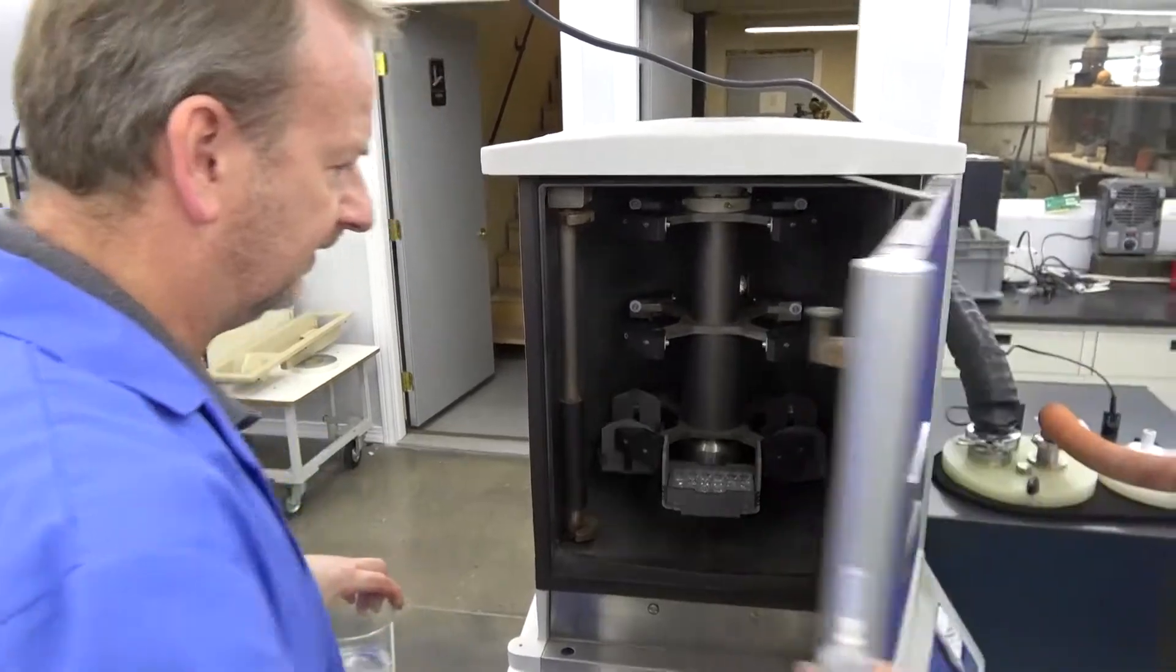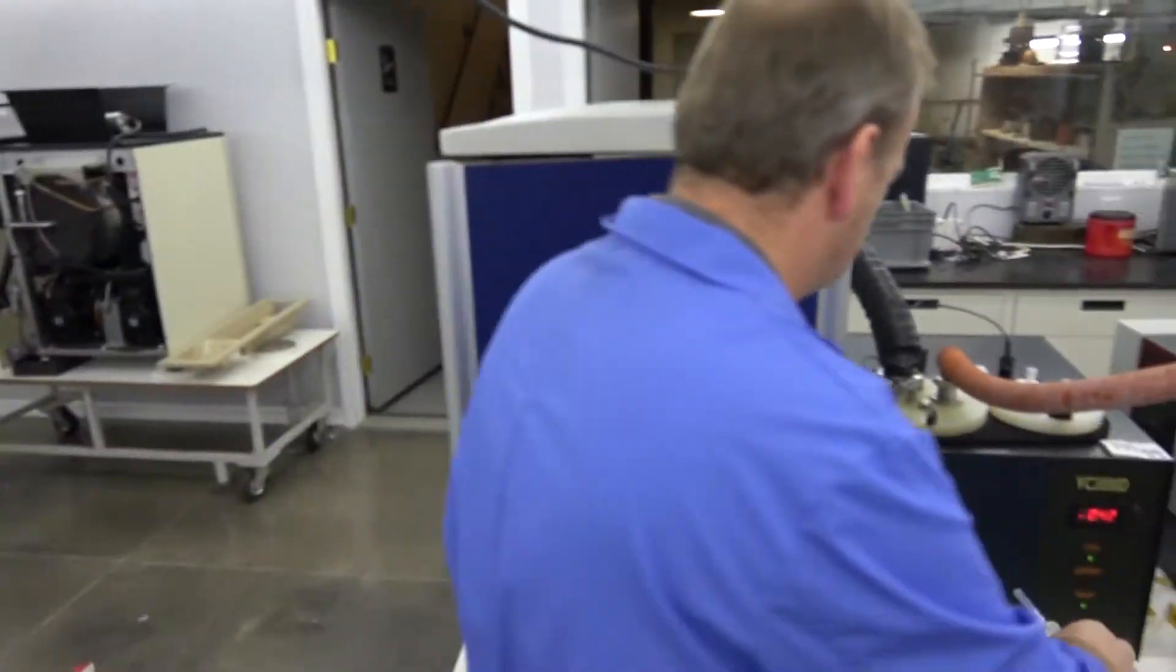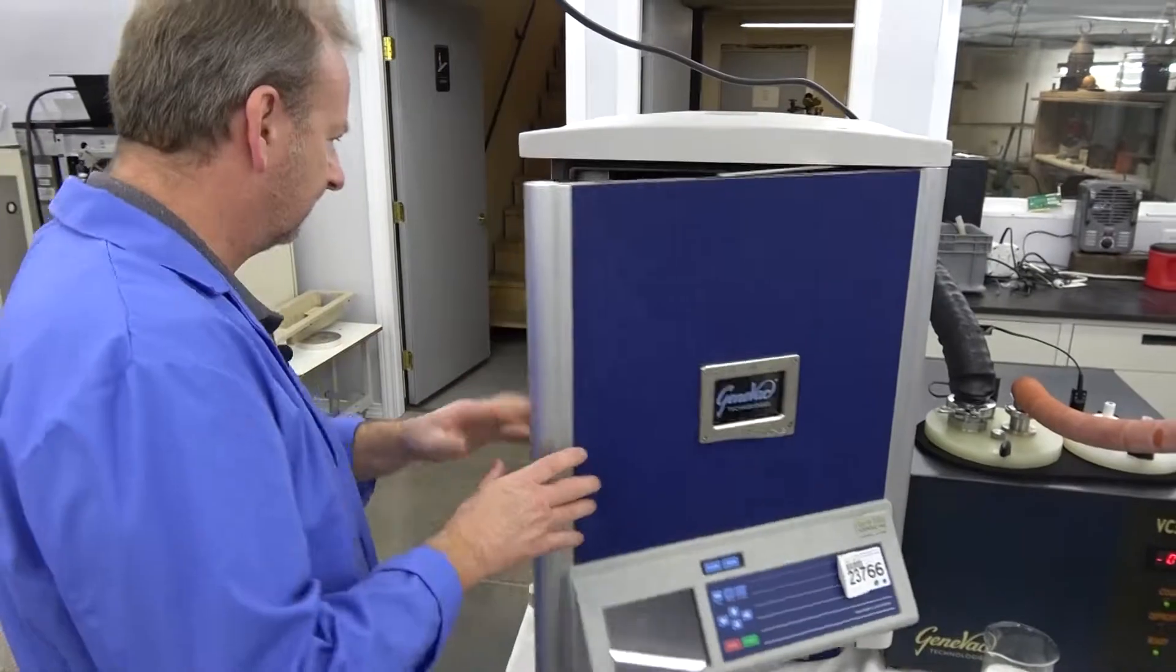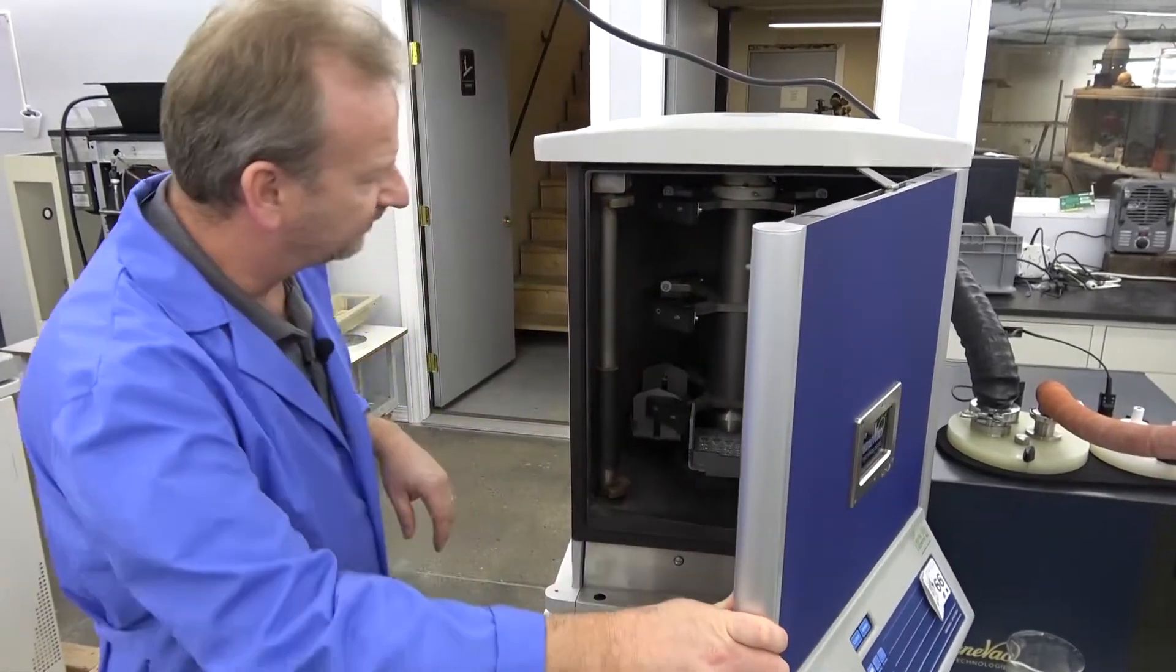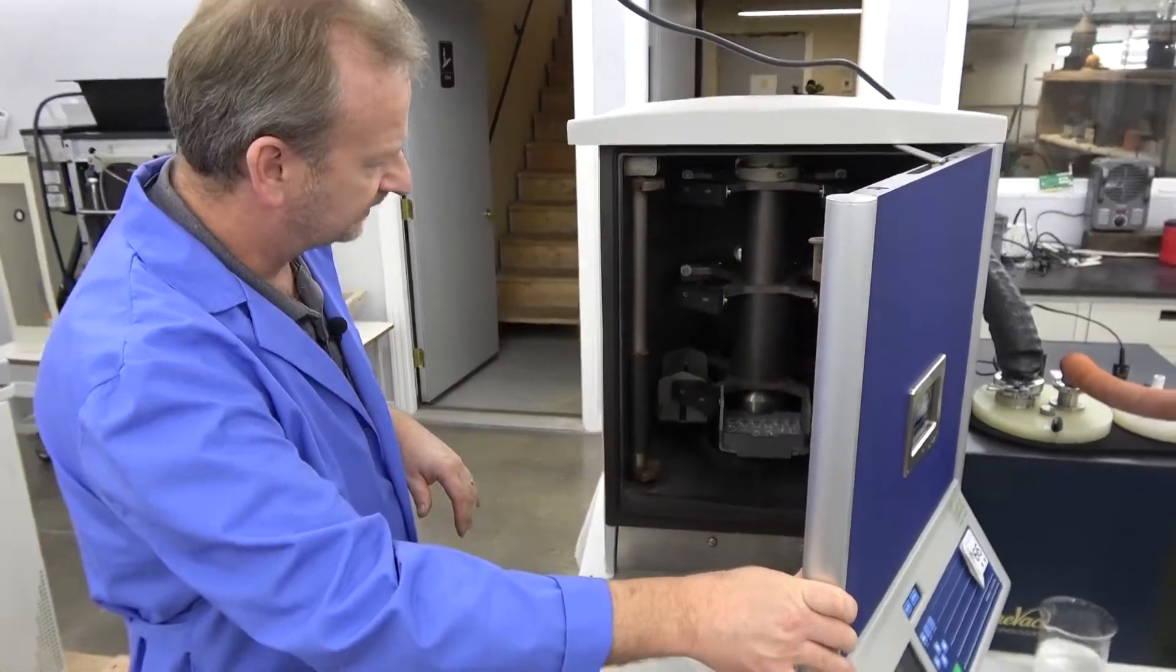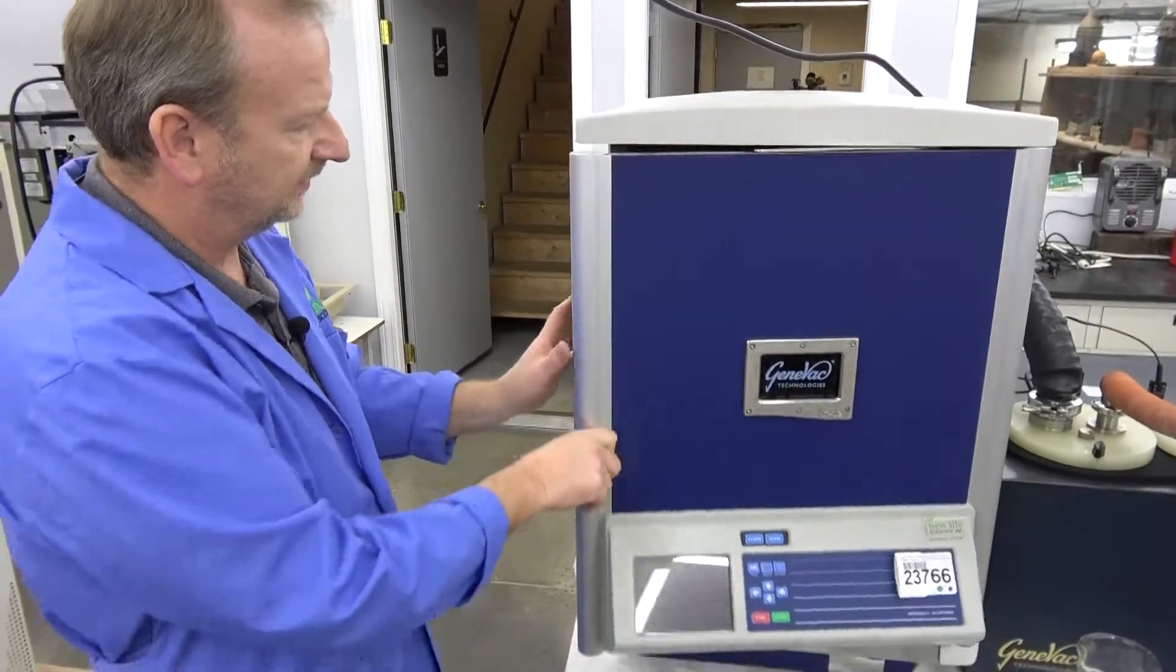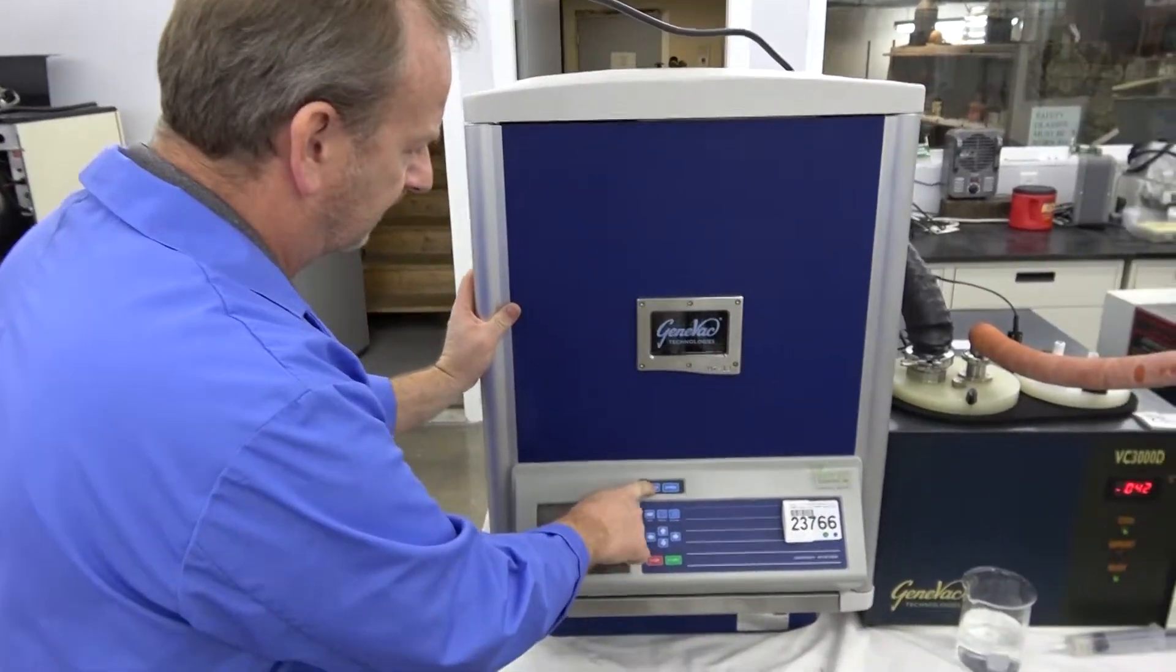Okay. We should have it fairly balanced, so the microplates shall spin with no vibrations. So just go ahead and close the door.